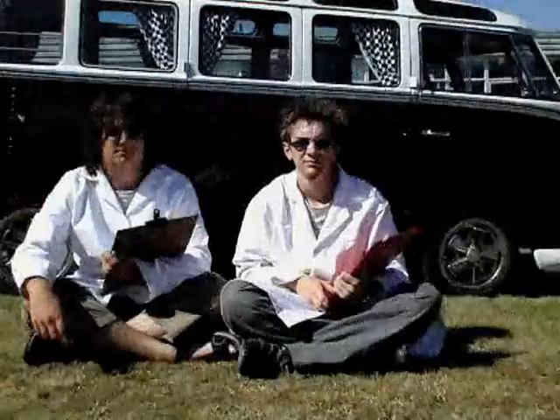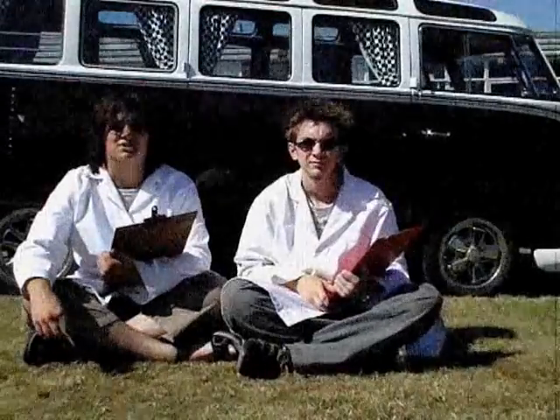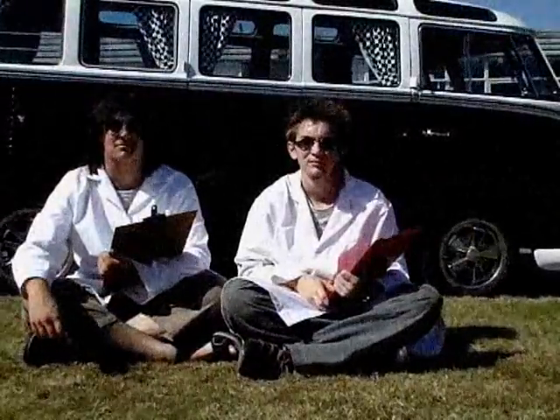No eating food in the labs. Goggles are a very important piece of equipment in the labs because they protect your eyes, because they are very vulnerable to things.